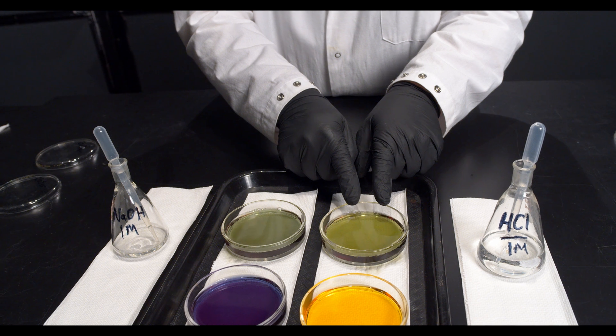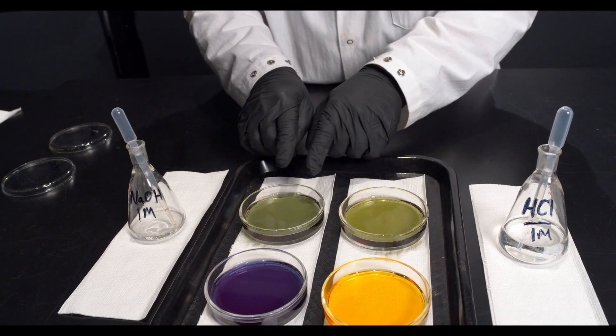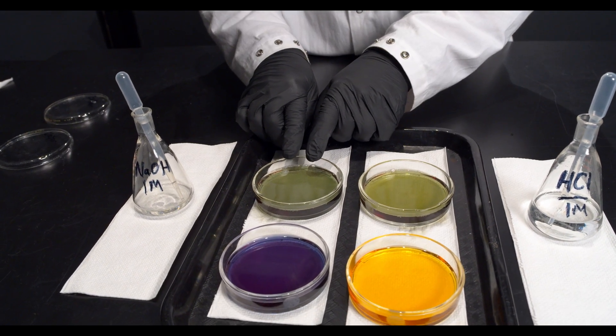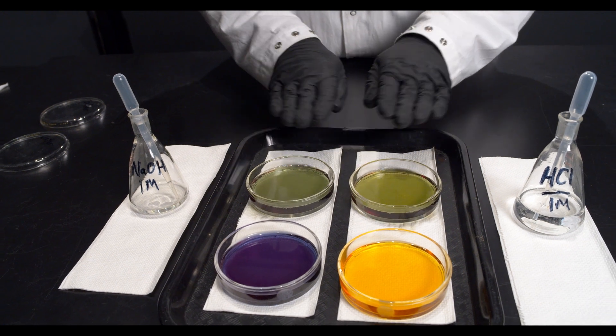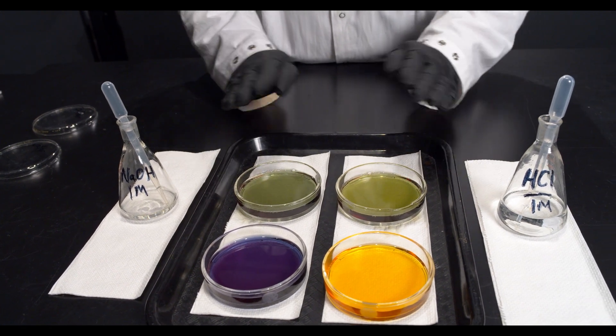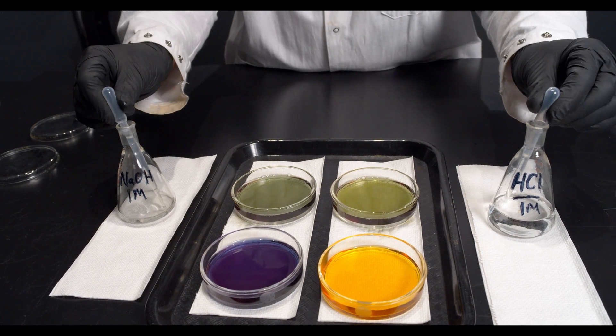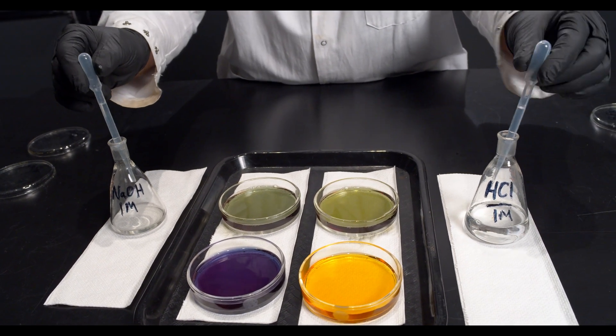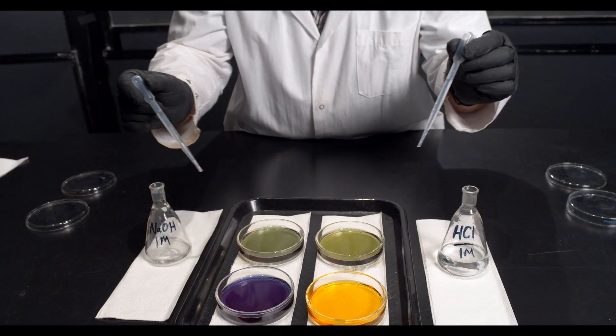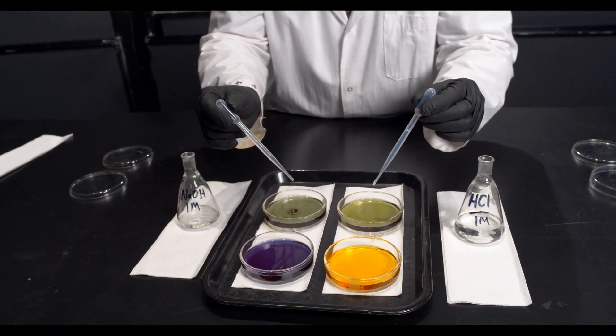Now to my eye, this side is starting to look a little bit yellow and this side is starting to look a little bit bluish, so they're diverging away from the green color that they started, but still it's taken a whole lot of addition to change those colors.